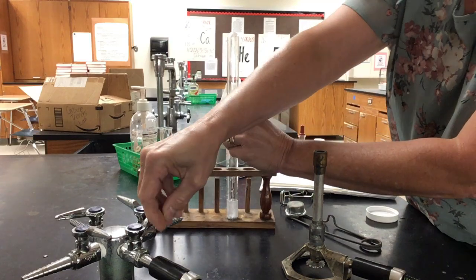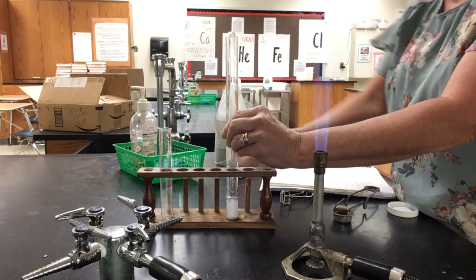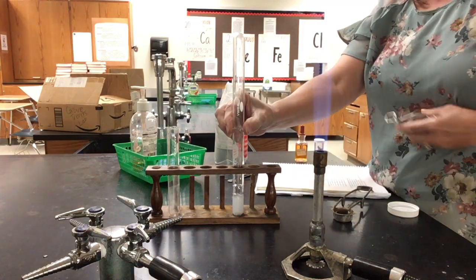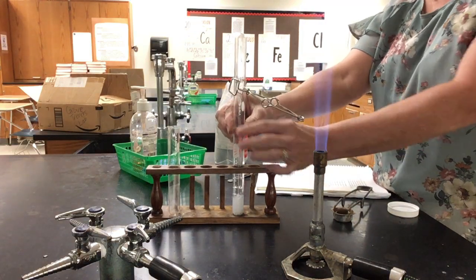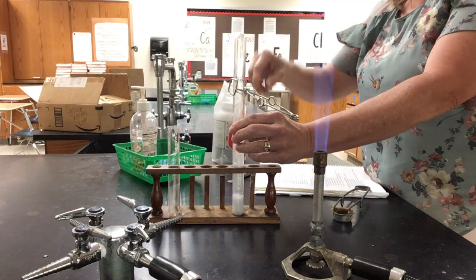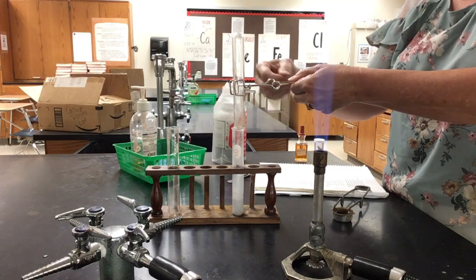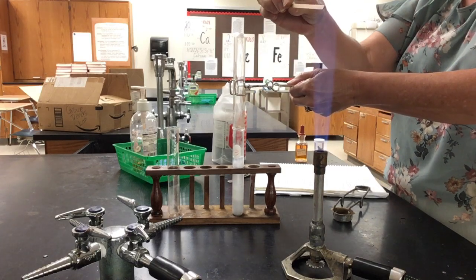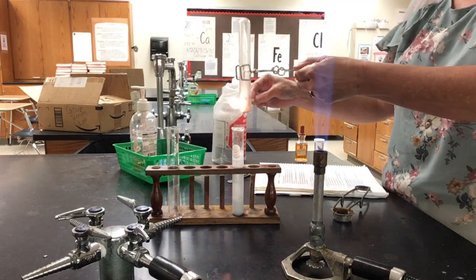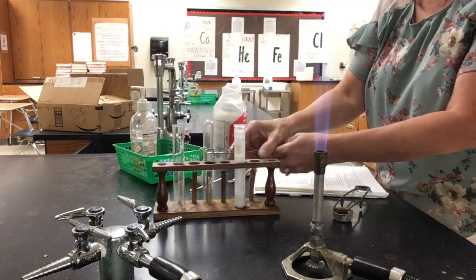Now I'm going to need to see if I can light my Bunsen burner one-handed. Should have lit it first. There we go. Okay, so we're going to let that react. I'm going to hold it with the flame. And then I'm going to light a splint on fire. Whoa, we got lots of gas coming out of there. I'm going to put the splint between the two test tubes, and hopefully we'll hear the popping noise indicating the hydrogen gas. Okay, there we go. That was a good pop. You can see that it's continuing to react.